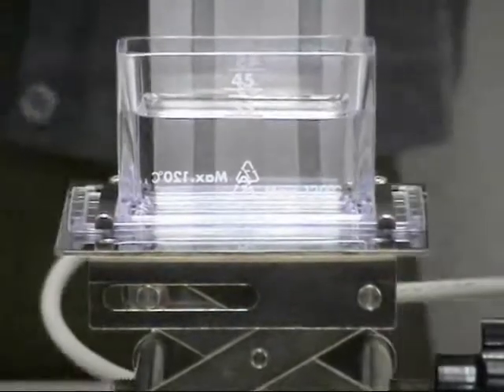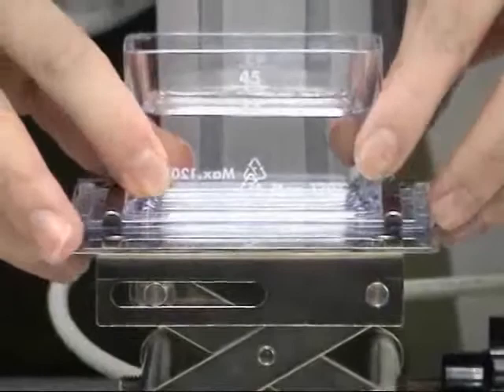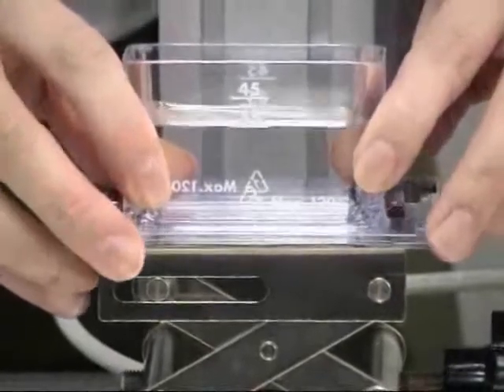The sample cup is fixed by guides on the table. Pull out the sample cup towards you.